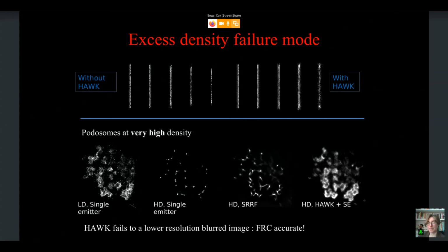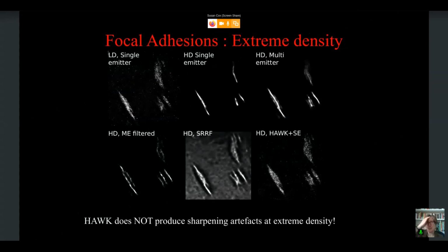And we can see from the quality of the data that we would expect it to be garbage. So garbage in, garbage out is often used as an insult, but in fact, when you have data analysis in science, you very much want it to be garbage out if it is garbage in. You don't want it to be garbage in, apparently Nature-worthy publication quality image out. And this is just a similar image for the focal adhesions. You can see when we get to these very high densities, on the bottom right, the Hawk image just doesn't look very good quality.